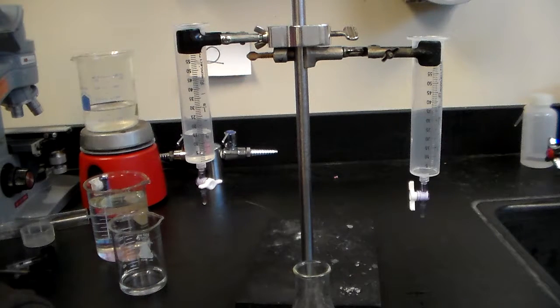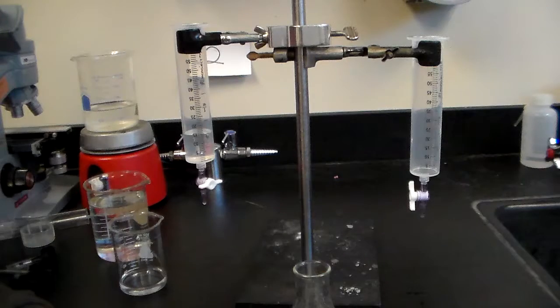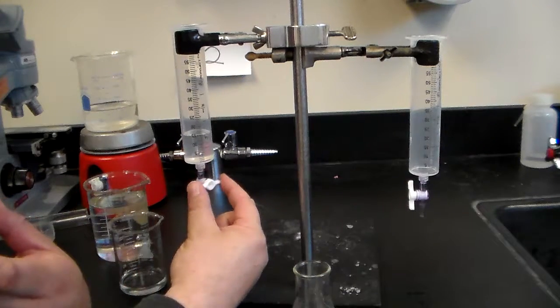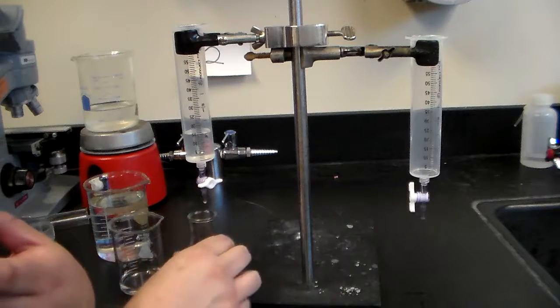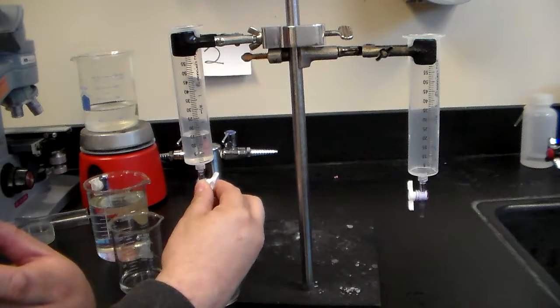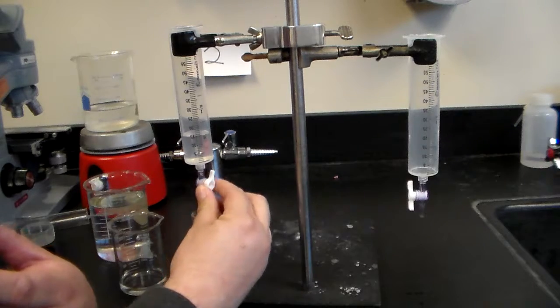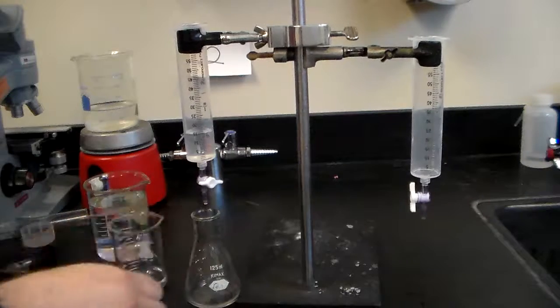Remember, be careful when you are working with the nozzles here. When you are turning it, turn it slowly, so you can control the drops that are coming in.